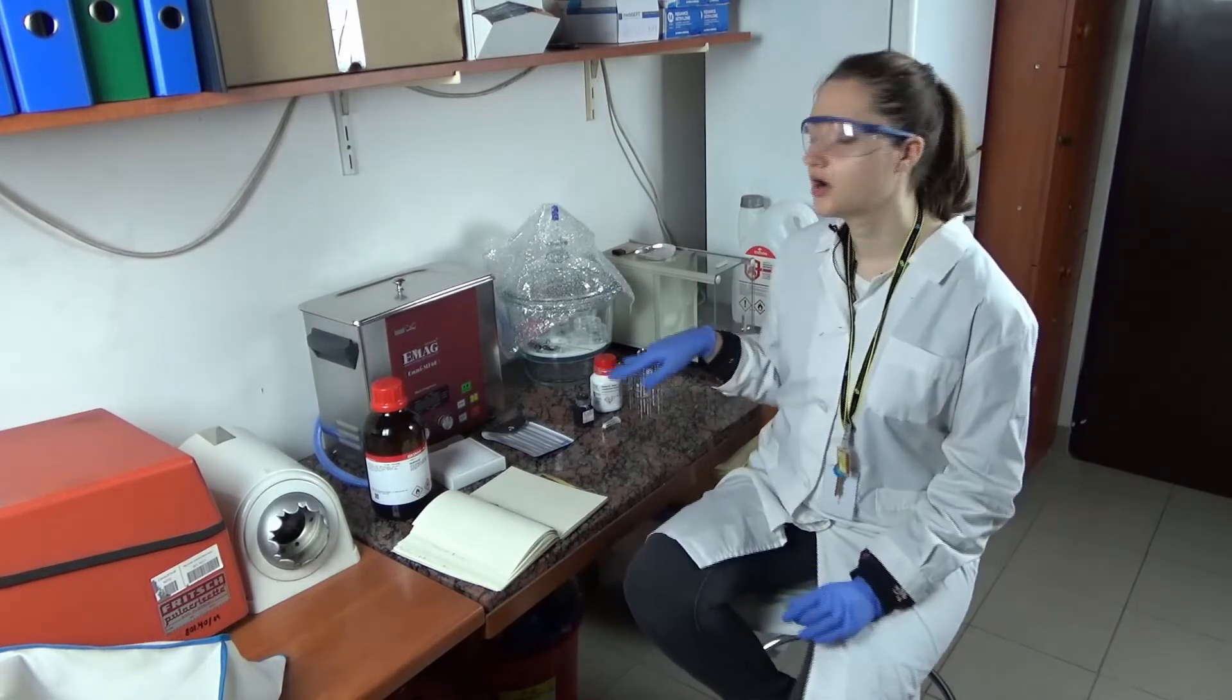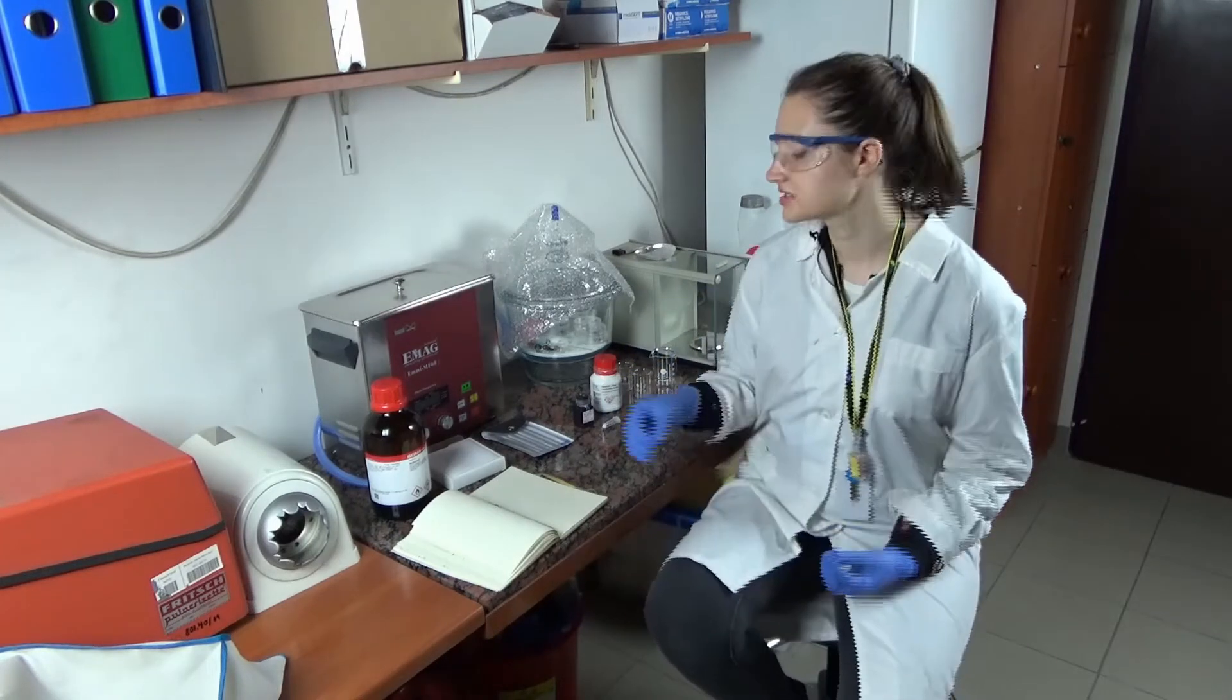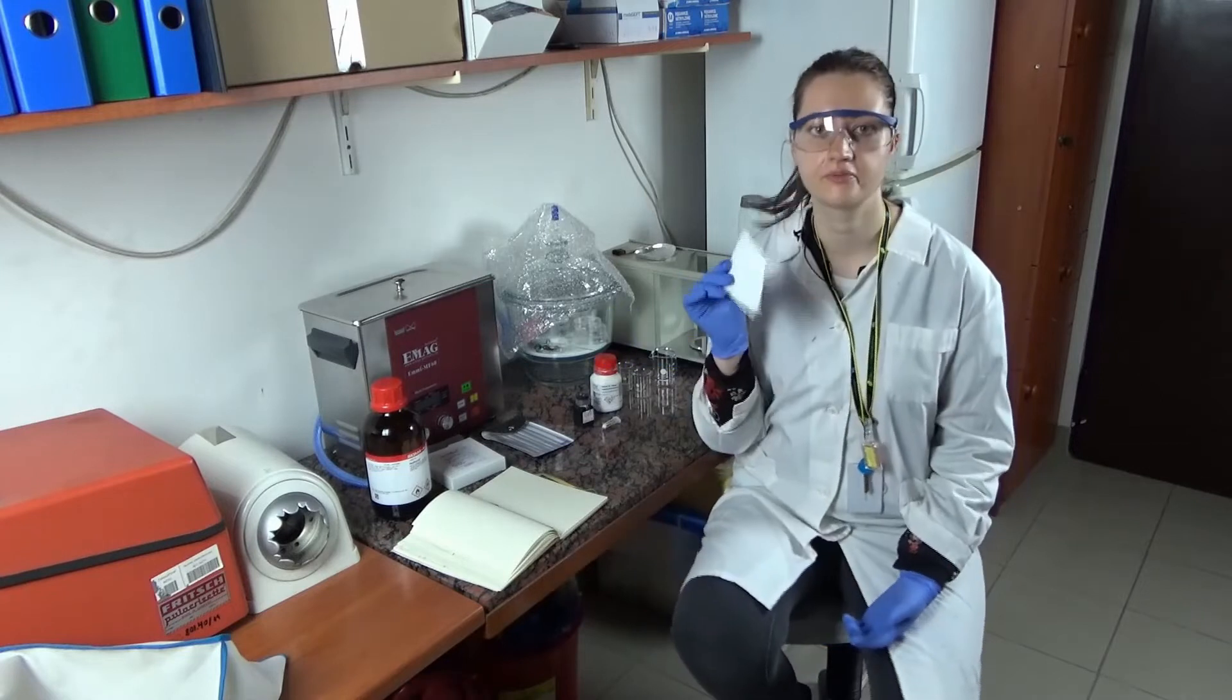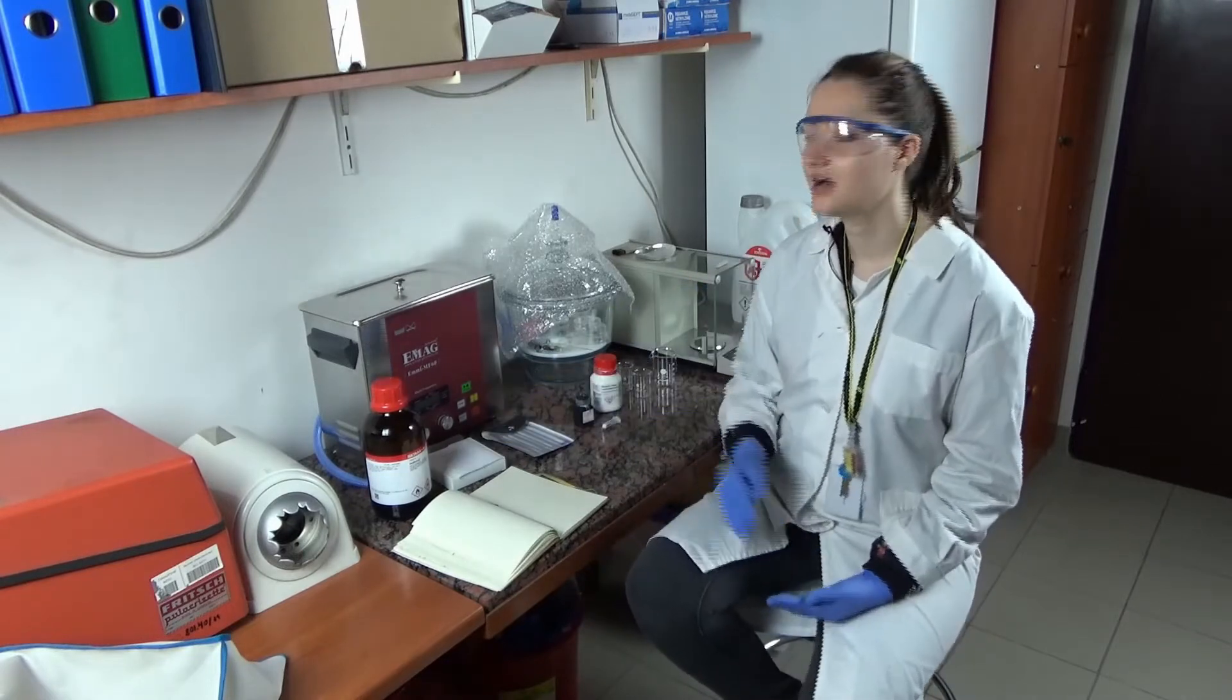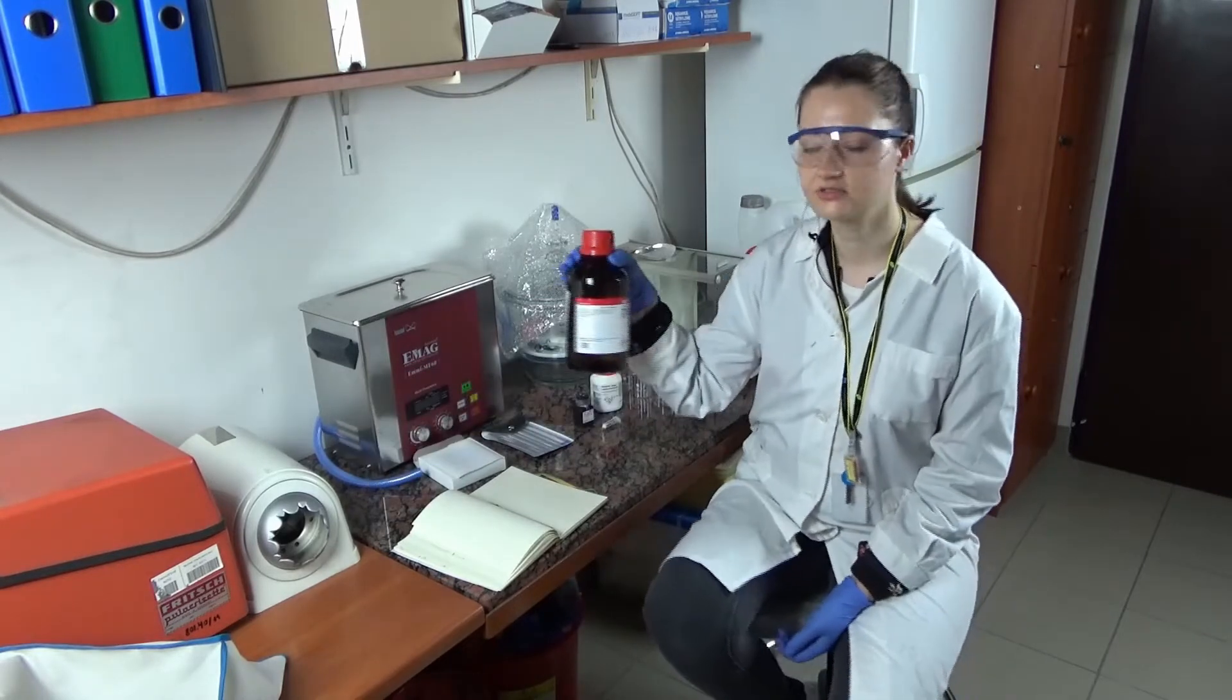After weighing, we will put all of the compounds into flasks. To ease that process, I will use some weighing papers. After putting all of the compounds into the flasks, I will add some methanol to dissolve them.